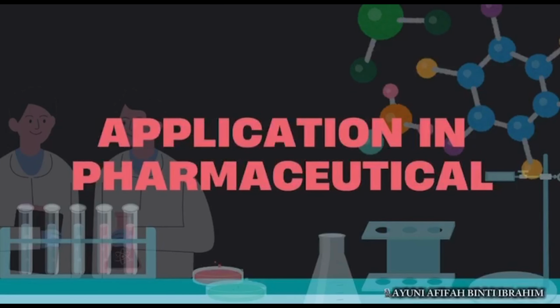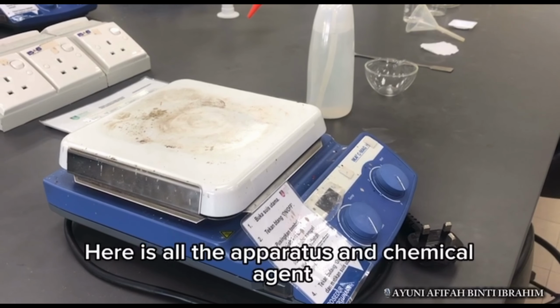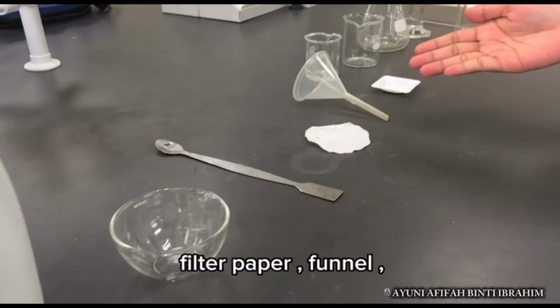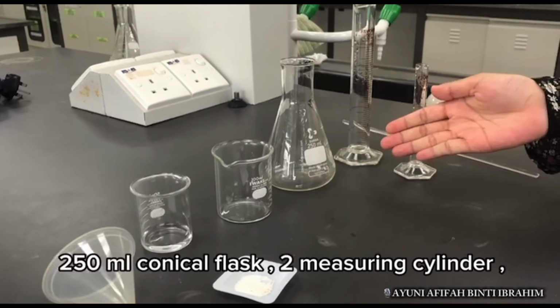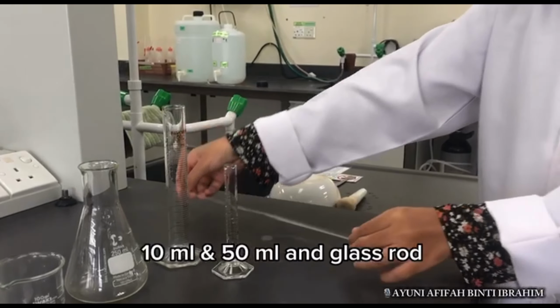Moving on to application in pharmaceutical, we choose preparation of paracetamol. What is paracetamol? Paracetamol is synthesized in pharmaceutical lab through the acylation of p-aminophenol using acetic anhydride. Here is all the apparatus and chemical reagent that we need to prepare before the experiment. Hot plate, distilled water, evaporating dish, spatula, filter paper, funnel, p-aminophenol, acetic anhydride, 100 ml beaker, 250 ml conical flask, 2 measuring cylinders, 10 ml and 50 ml, glass rod.